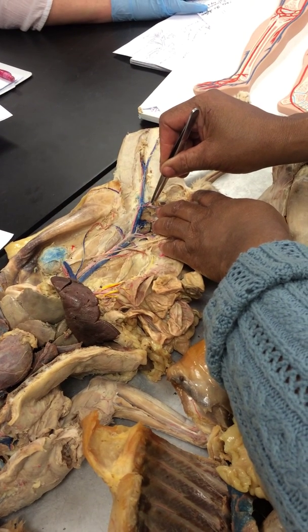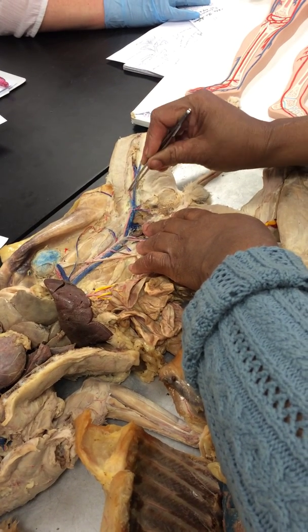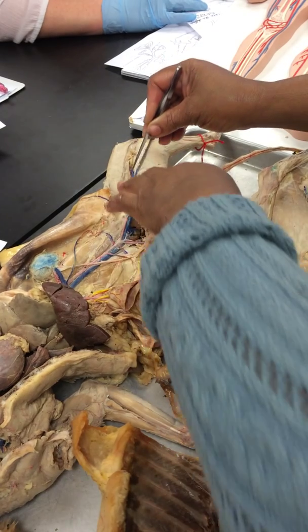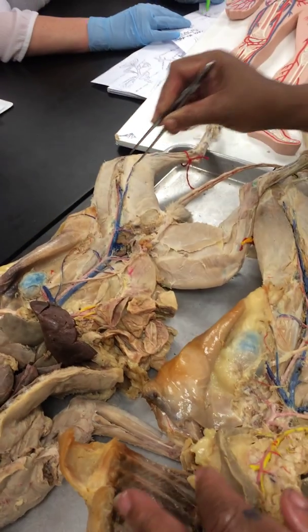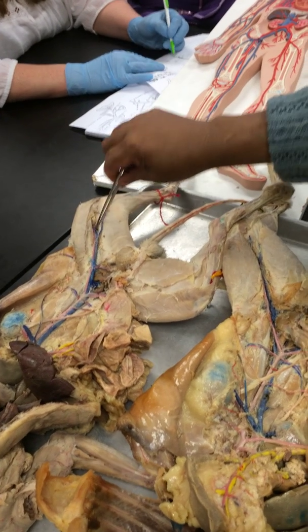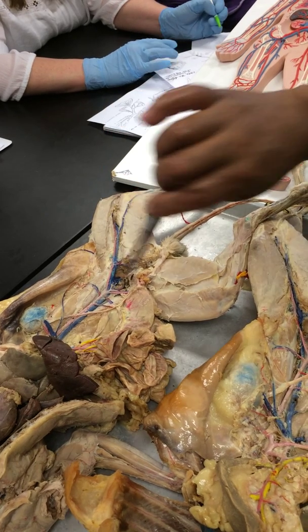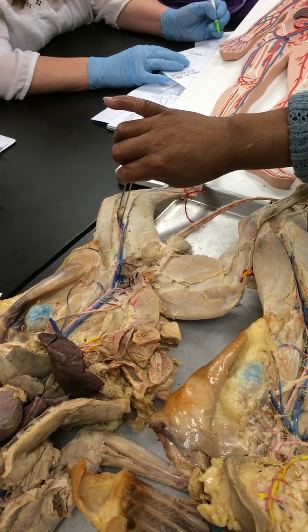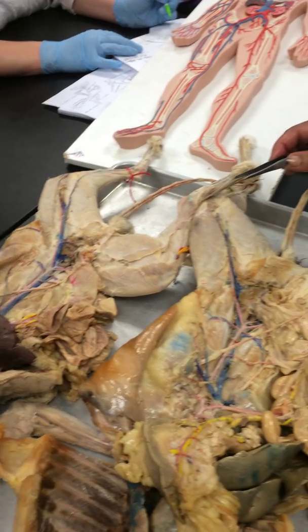This is the deep femoral. Right? And then beyond that, this is the femoral. And it's femoral until you get to the back of the knee. That's what my dotted line is. The popliteal. The popliteal goes into the knee and it comes back out again. So that's what I'm trying to show with that little diagram there. So it goes behind the knee and it can come back out and rejoin the vessel down here.